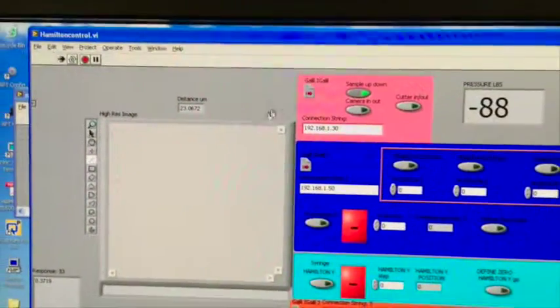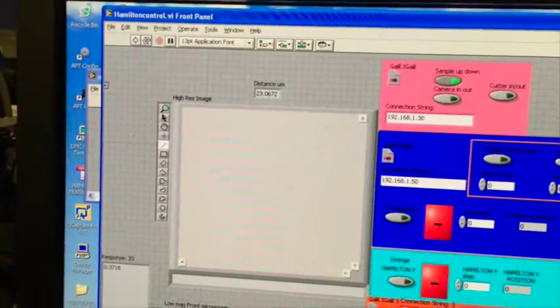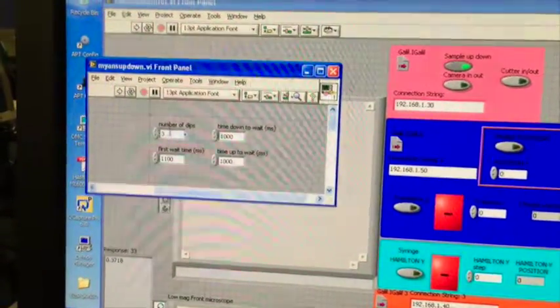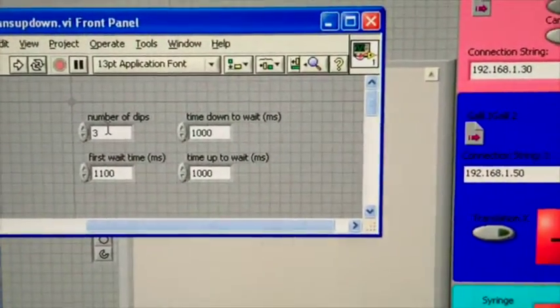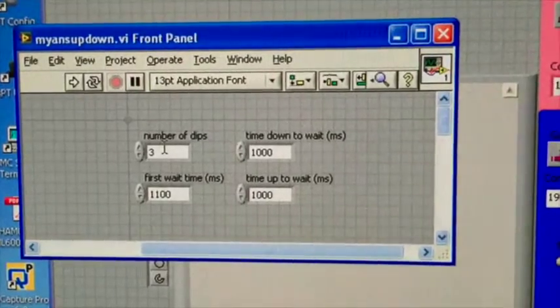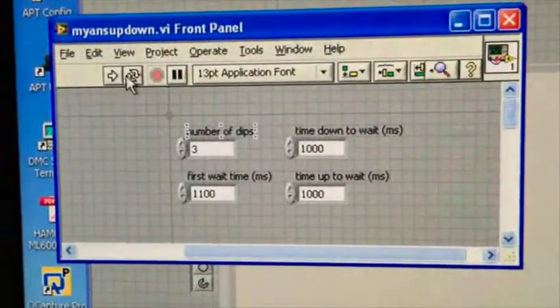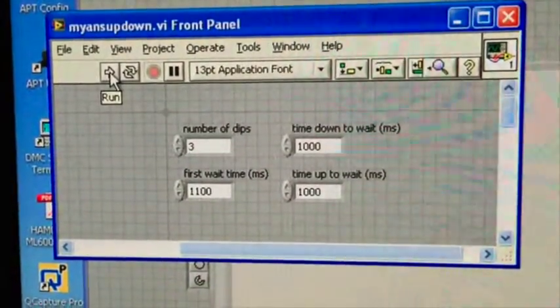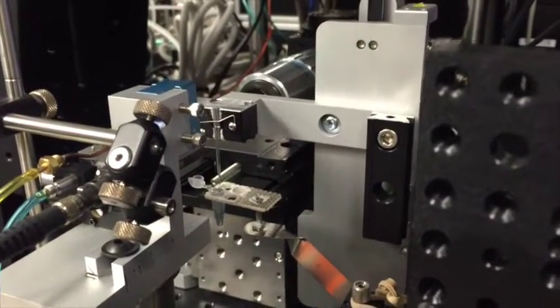So for the purposes of the LabVIEW program and a safety mechanism, you have to stop this, and the way you stop it is right there. I'm going to bring up the dipping program, which is right here. Here are the settings for the dipping program. The only thing we're going to move around is the number of dips. For the polylysine, we're going to dip 3 times, so it's ready to go. And when I hit this button right here, it's going to turn to black, and my arm's going to go up and down 3 times. You can hear it. 1, 2, 3.